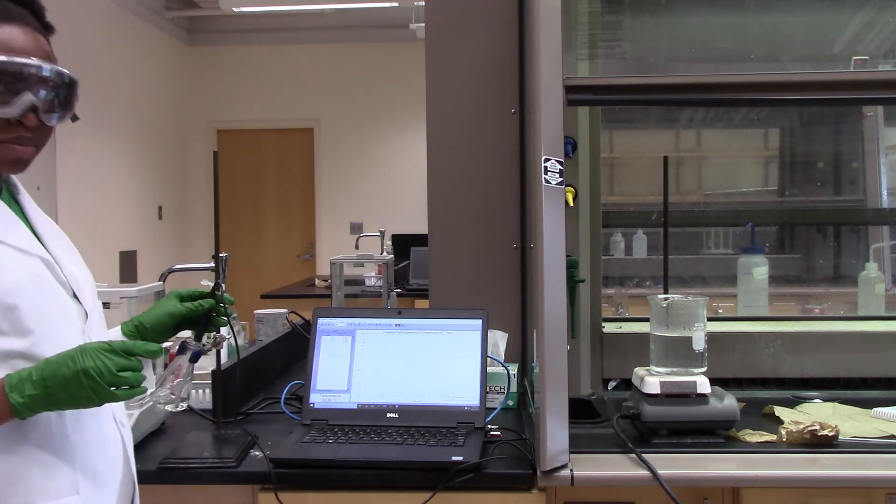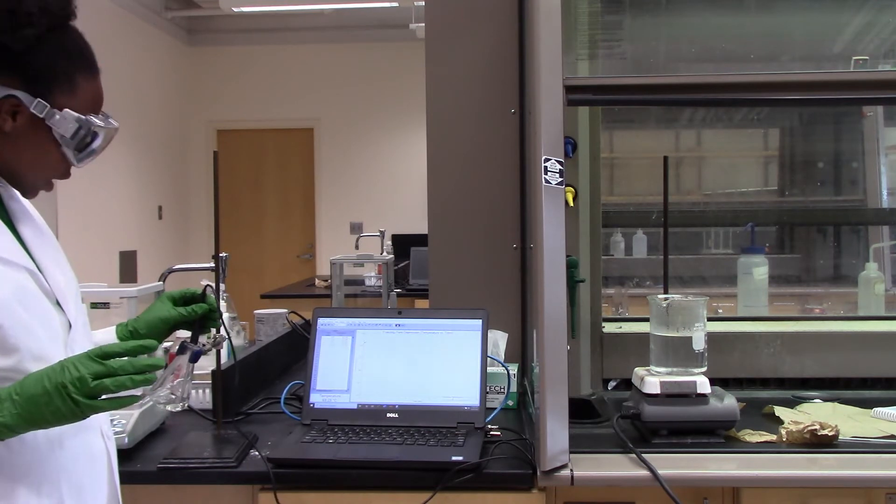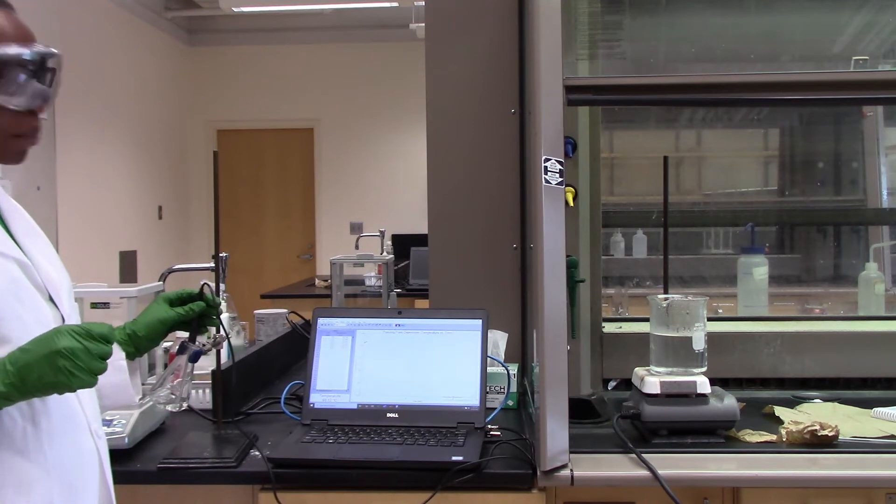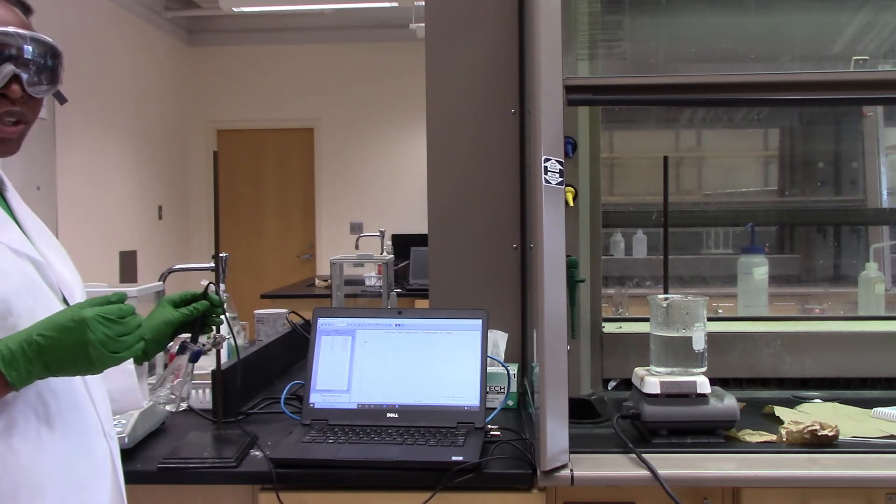So as I'm collecting this data, it's starting at about 62 degrees, and I will constantly stir it just to make sure that I have uniform temperature throughout the experiment.